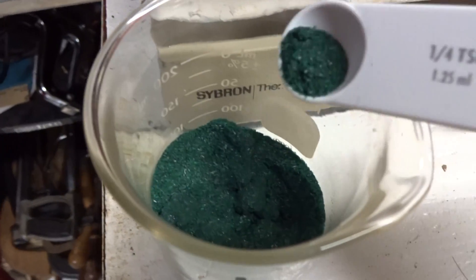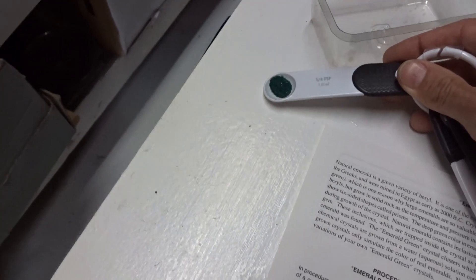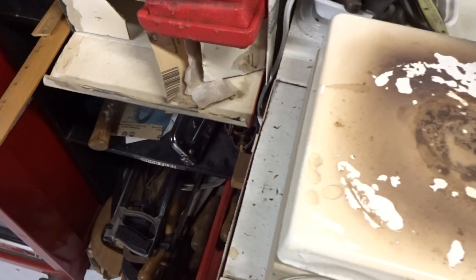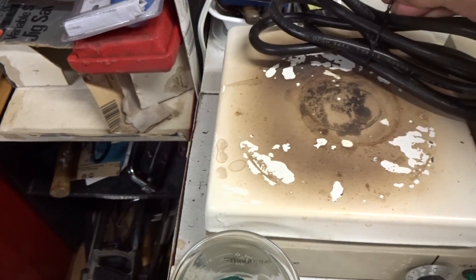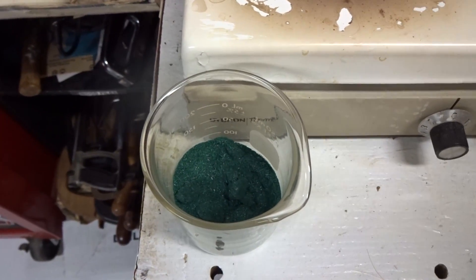I don't really need much crystals. This is enough — easy. Once it goes to super saturation, we mix in the contents according to the amount that we must.